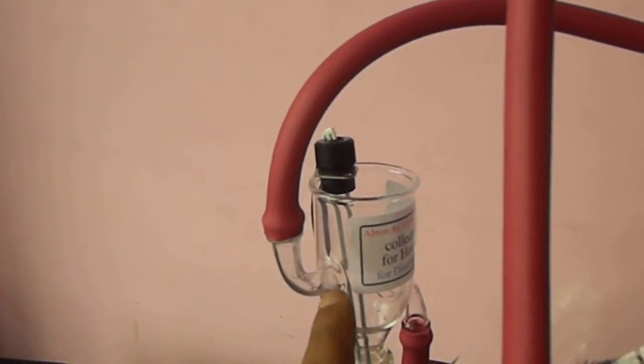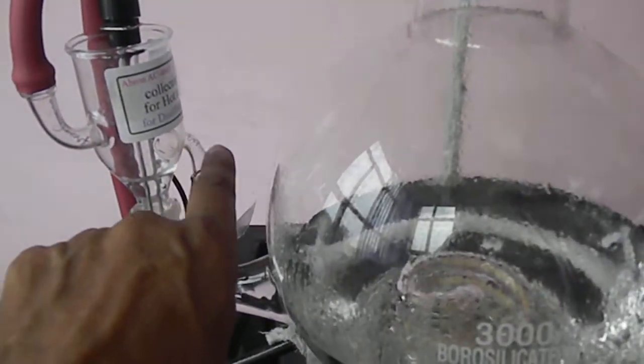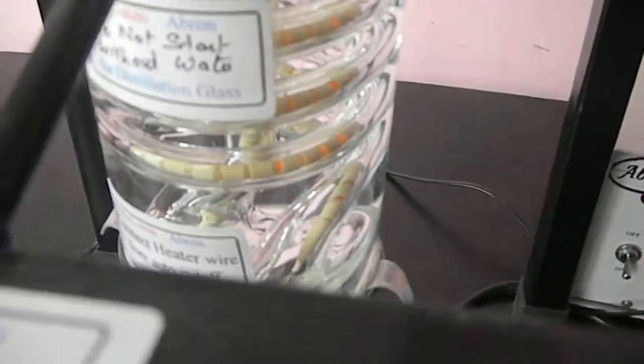This cup will slowly fill with water. Hot water will automatically fill this flask with a minimum level. Extra water will come out from this. Now I have just started. You can see the heaters are going.